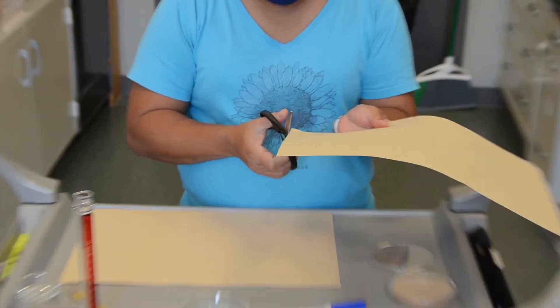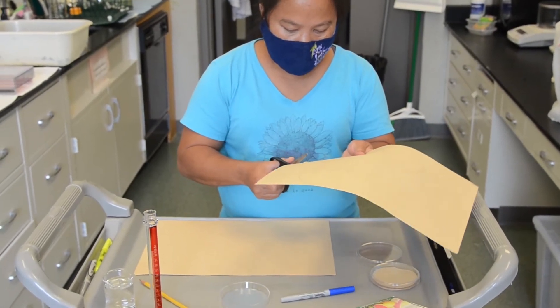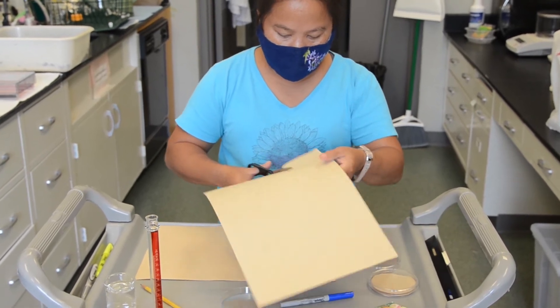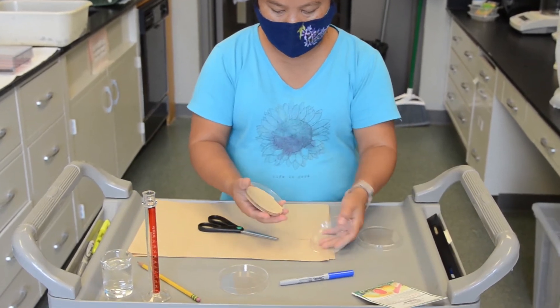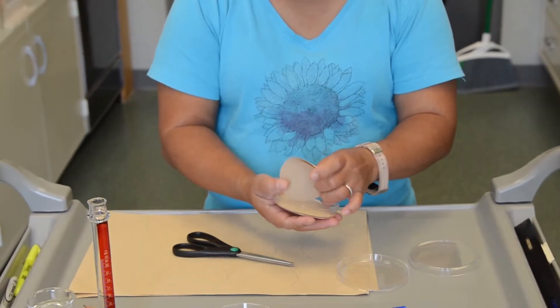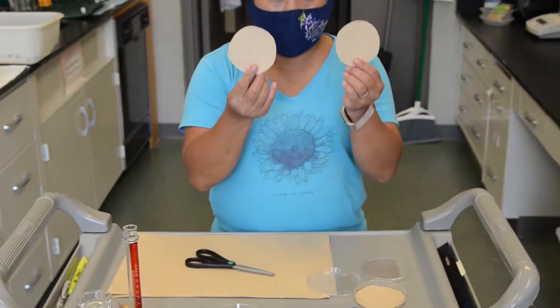So in this process, you might cut slightly inside the circle that you draw because it will fit the bottom part of the petri dish quite well. So after you cut that, you will get a piece of the seed germination paper like this one.